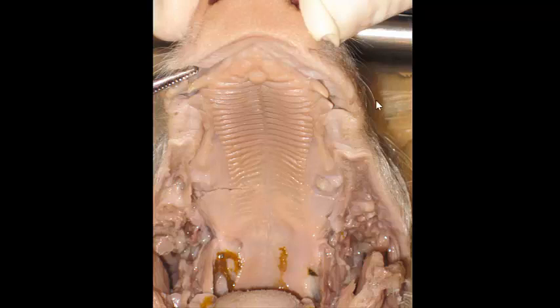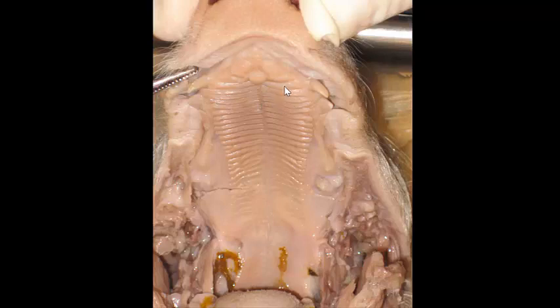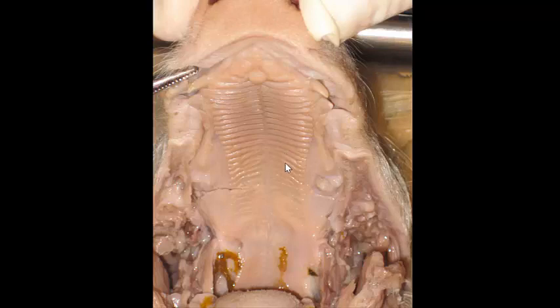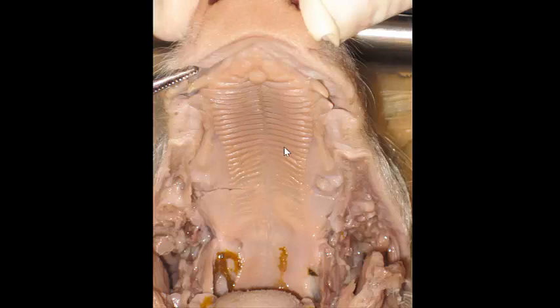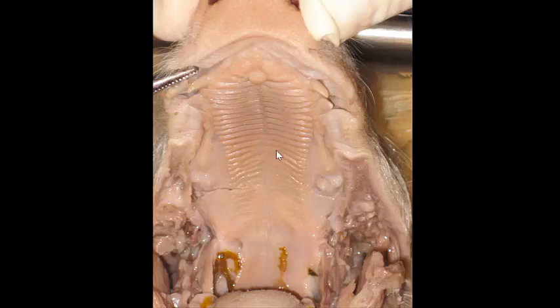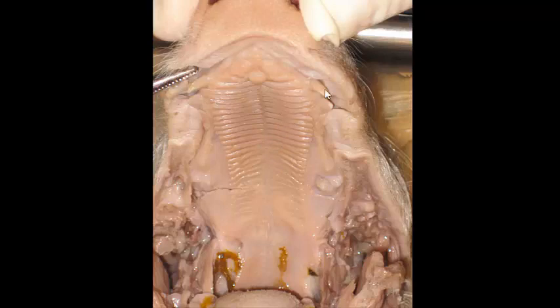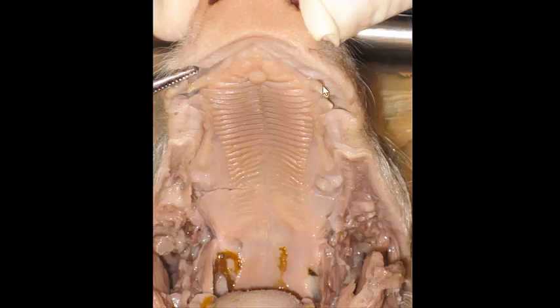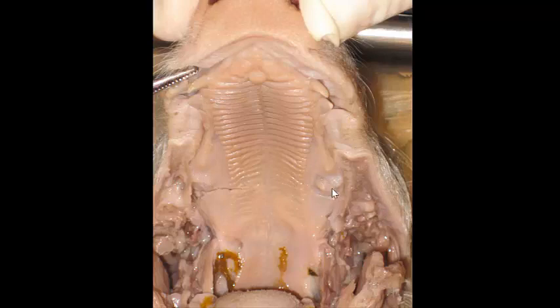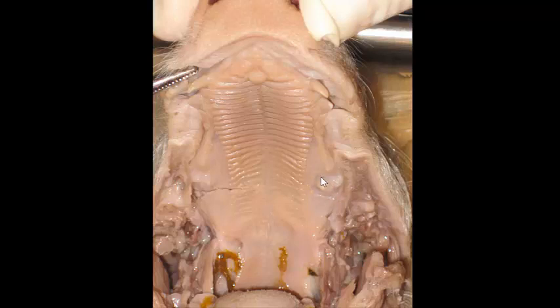These are the oral structures of the fetal pig for digestive. We're looking at the roof of the piggy's mouth. The pig's snout and nose are up here. The ribbed appearance that you see here appears on the hard palate of the pig. If you felt this with your finger you can feel there's bone underneath — it's hard. So that's hard palate. Over here, that's a tooth, and for my class we're going to call this a canine tooth. Back here, where I've removed some of the mucosa, that has exposed one of the pig's molars. So that's a molar tooth.